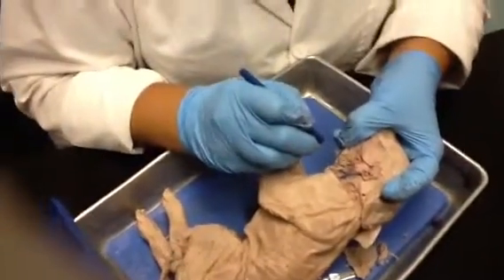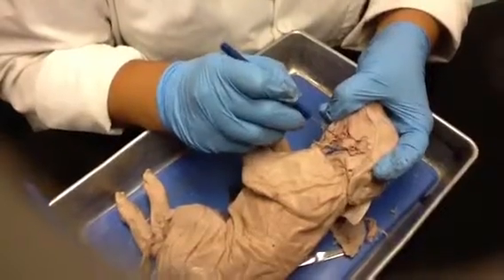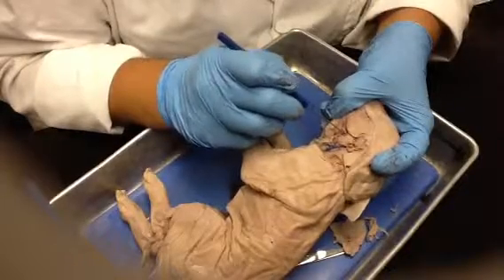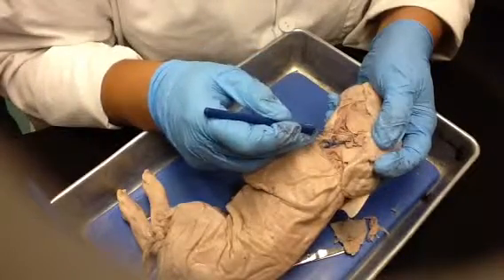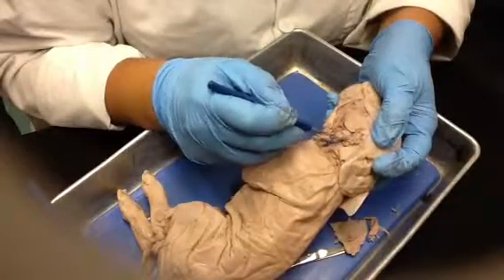This one here that looks like a bean, that one's your submandibular gland. This one right here, that's a little bit smaller, and there's another little piece of it right behind here. This is going to be your sublingual gland. And this here that has the duct that comes off of it is your parotid gland. This is just a piece of it.